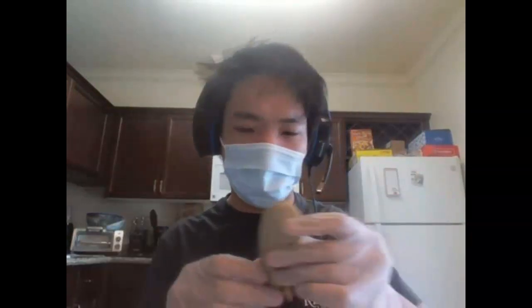Alrighty, so today I am going to be talking about the kidney. Now, I know that the assignment said a sheep kidney dissection, but apparently this was a pig kidney, according to the packaging right here. And now I was wondering, is the packaging wrong? This should be a sheep kidney, right? But after doing some research, I did finally confirm that this indeed is a pig kidney. The reason being is because it's more ovular in shape, whereas a sheep kidney is more circular.